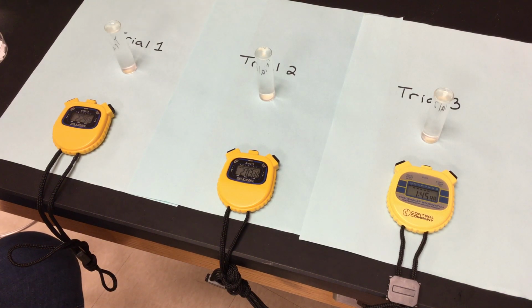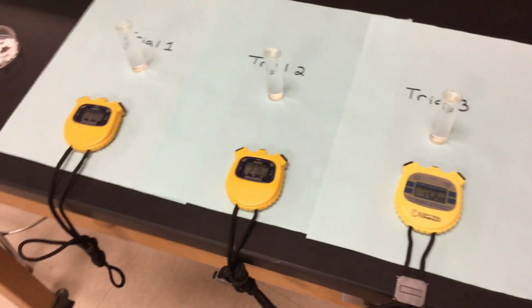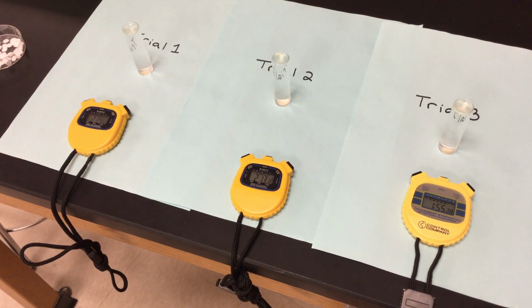Once again, my little yeasty guys, they are in warm water. We're trying to keep them warm and trying to keep them happy so that we can let them grow and so that this reaction can work. Trying to give them a little sugar. And we'll let those timers go. Keeping an eye on them to make sure that those little discs make their way to the top. So we're almost at 3 minutes on that first one that you guys see. We're letting it go.